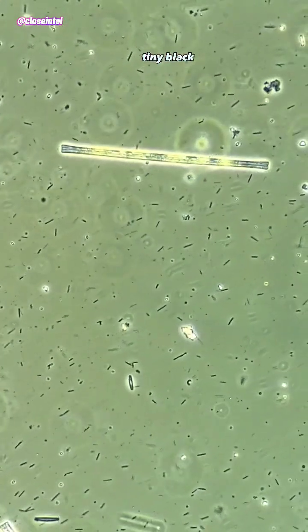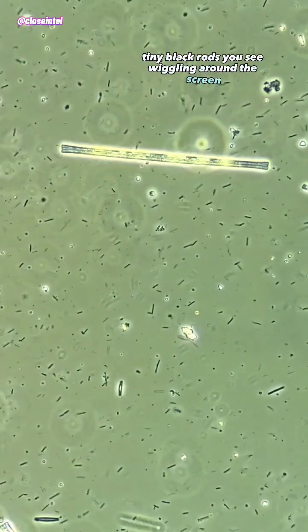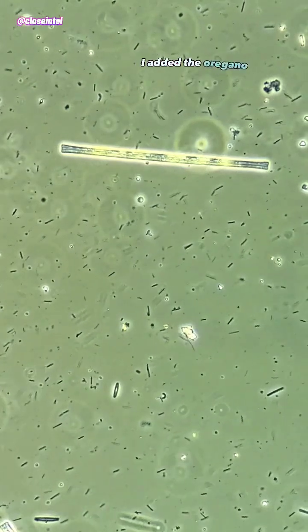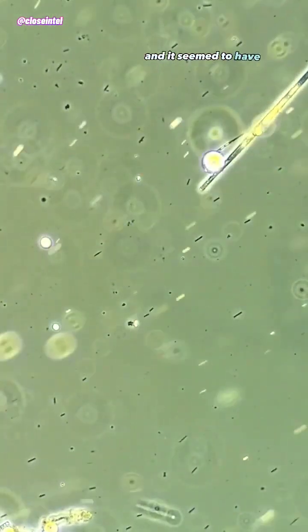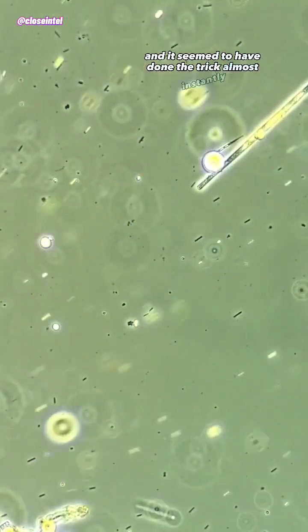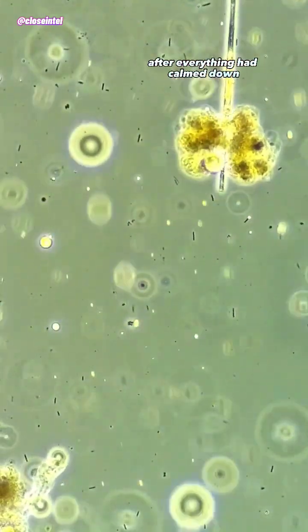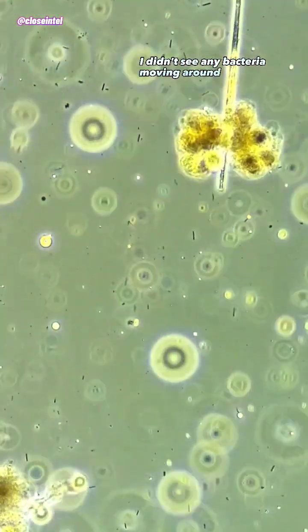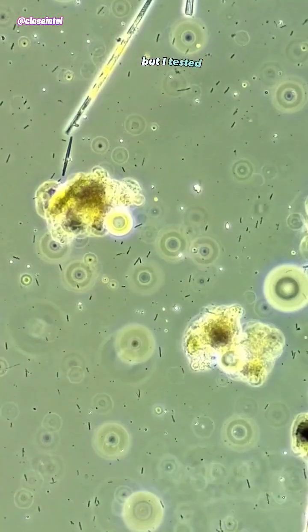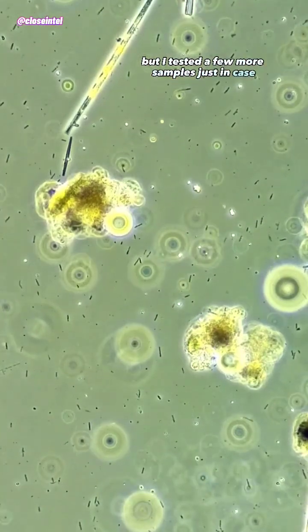They're most of the little tiny black rods you see wiggling around the screen. I added the oregano oil solution here and it seemed to have done the trick almost instantly. After everything had calmed down I didn't see any bacteria moving around the slide, but I tested a few more samples just in case.